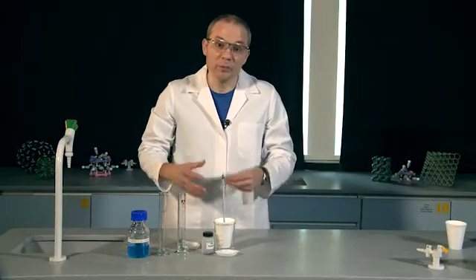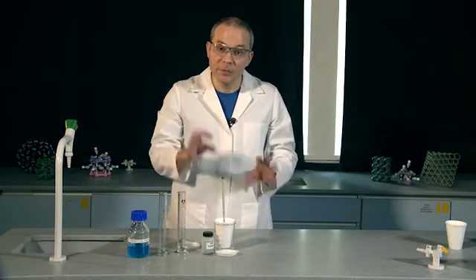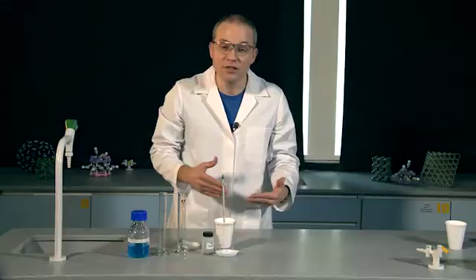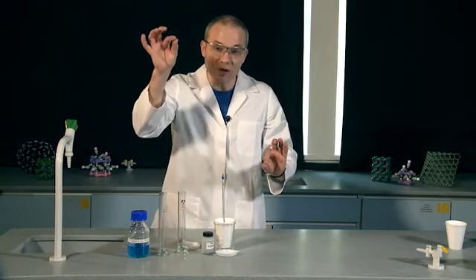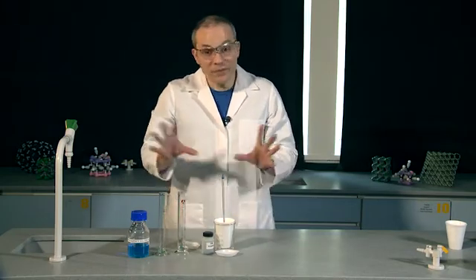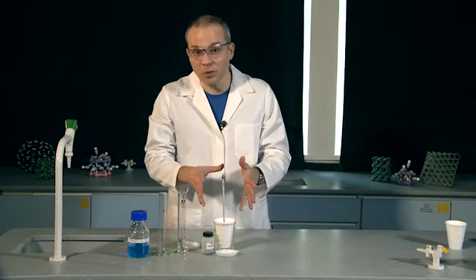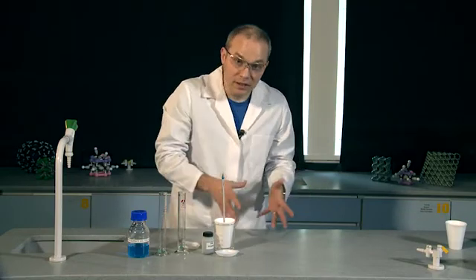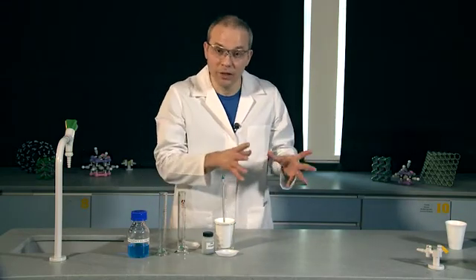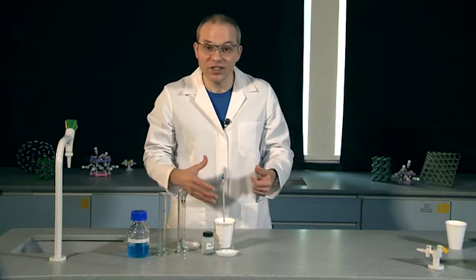We can see from those two results that the mass of zinc clearly affects the temperature rise of the reaction. With half a gram we get a much smaller temperature increase than with one gram. To be more confident of the relationship, I'd need to do at least three or four more masses — maybe 1.5 grams, 2.0 grams and so on — then plot mass of zinc against temperature rise. You could investigate any of the other variables the same way: pick one as your independent variable, measure temperature rise as your dependent variable, and keep all other possible variables the same as control variables.